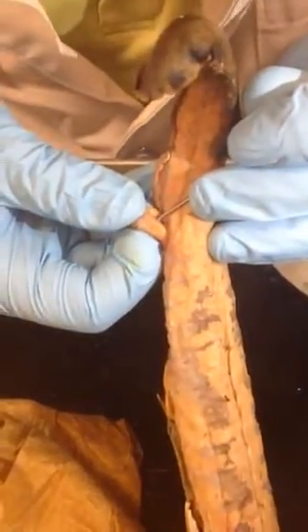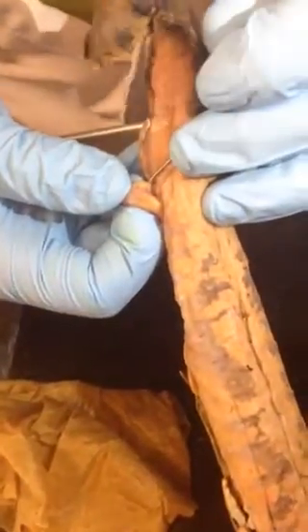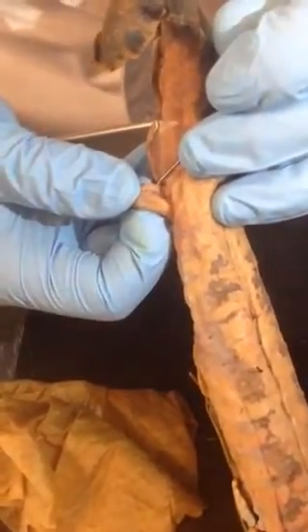That one is iliofibularis. And this one down here, this is also from the other side. So you gotta be careful when you look at this. And that is everything you need to know about the mud puppy.